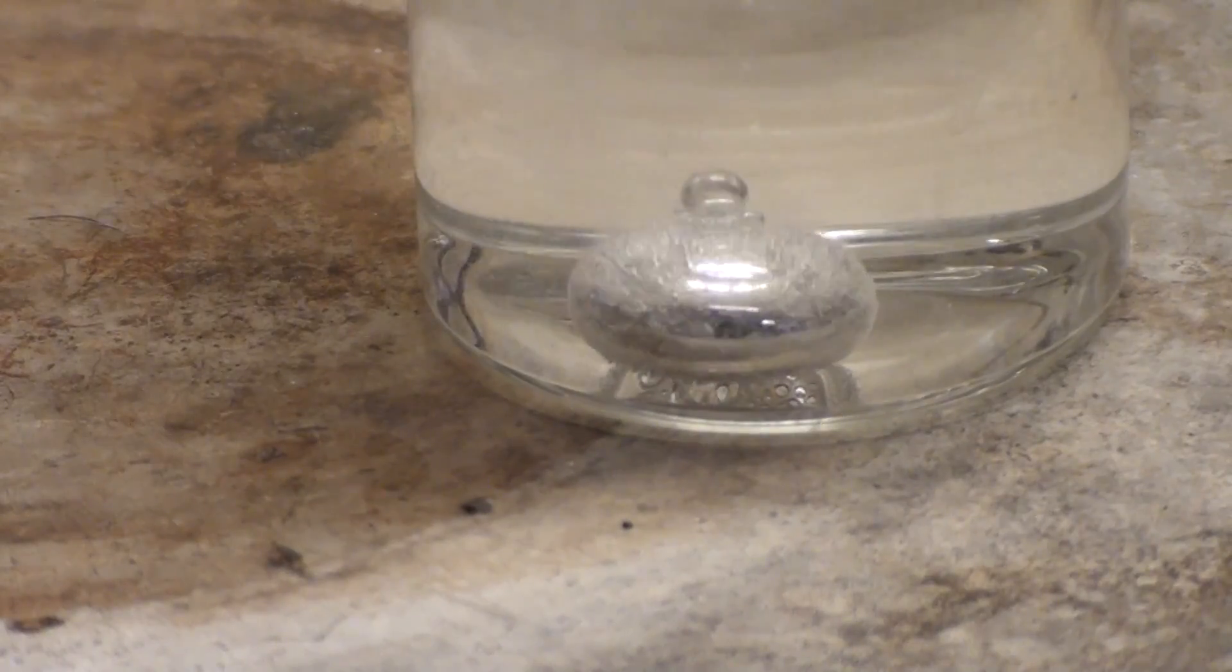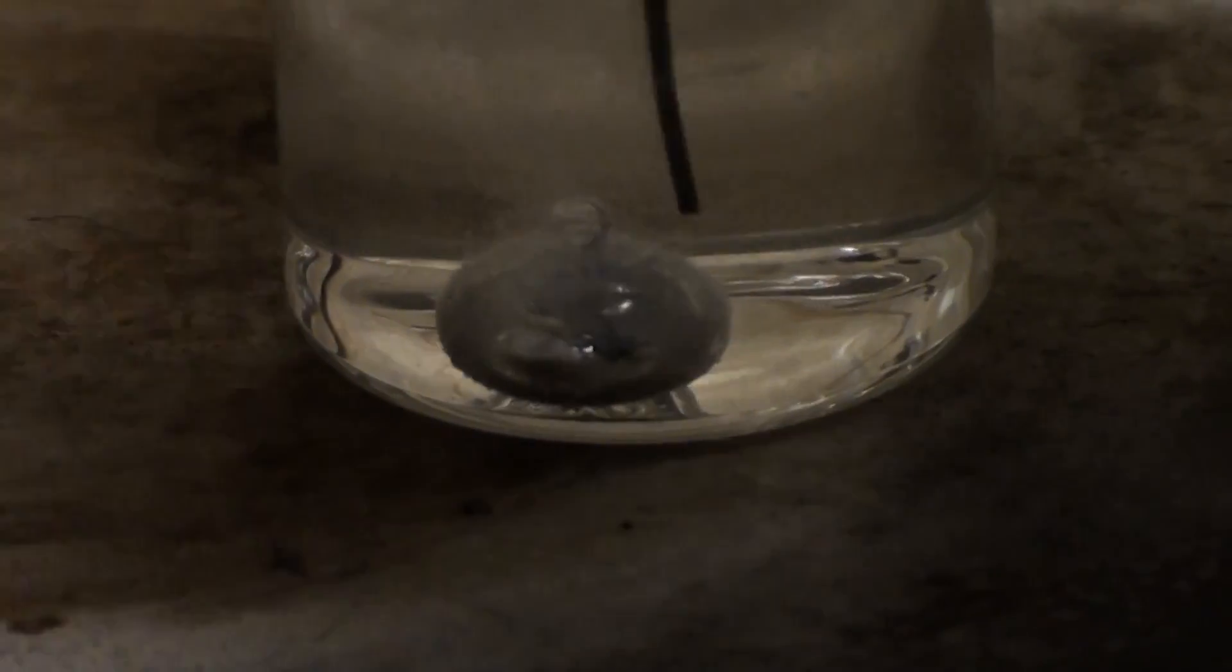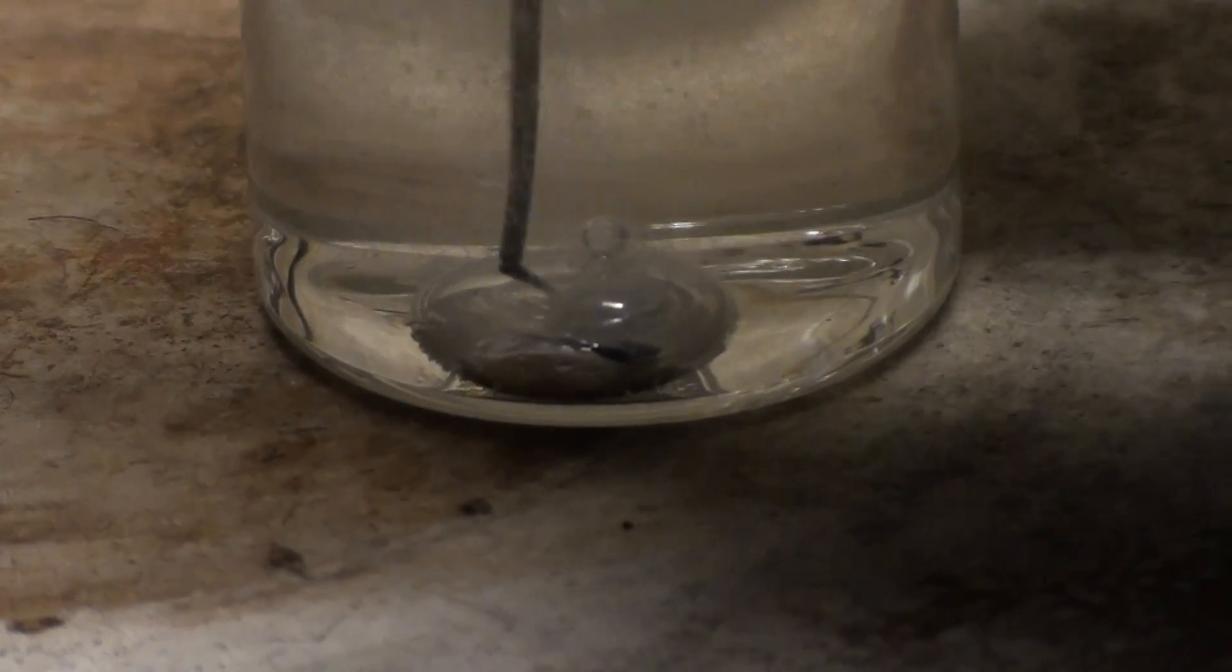Okay, the gallium is ready. Now gently touch the top of it with an iron nail or iron wire. The gallium will relax and flatten out.